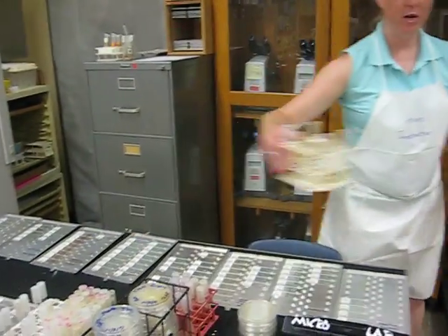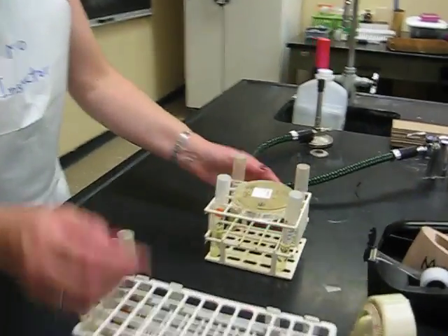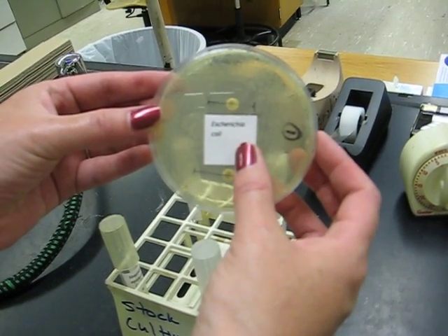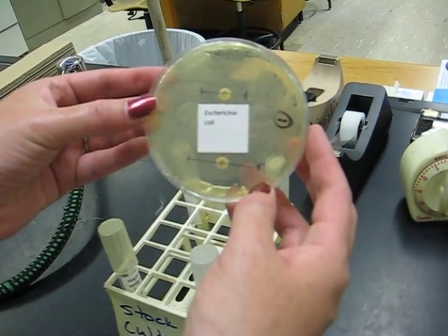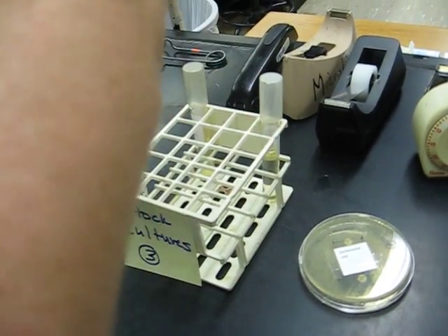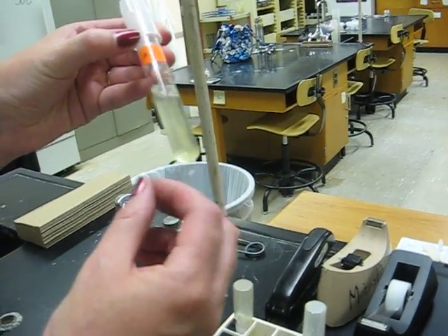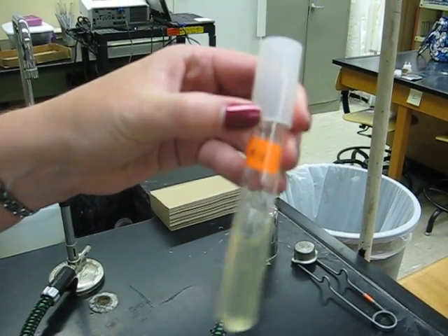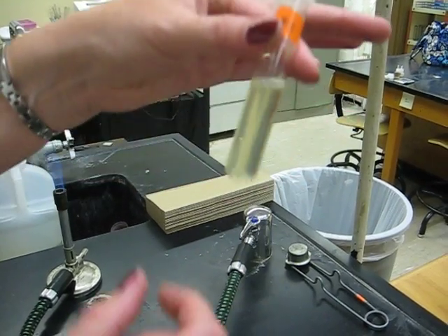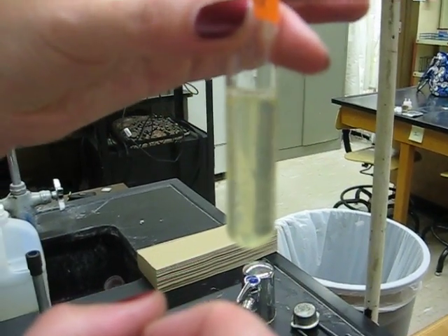The other thing on your lab bench will be your stock cultures for your group. We have four different stock cultures. We have a petri dish which has E. coli on it, as the label says — it also has some antibiotic testing on it. We have a broth culture that is a mixed culture of two organisms. To mix it, you flick the tube — gently hold it between two fingers and flick with the other one to get a nice suspension. You can see the organisms that fell out of suspension now coming back into suspension.